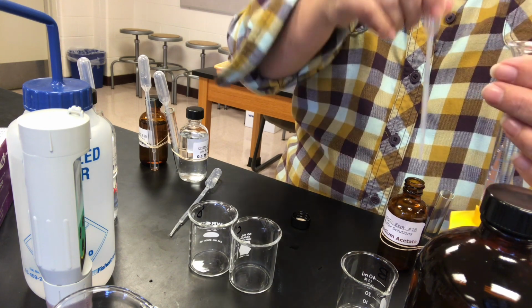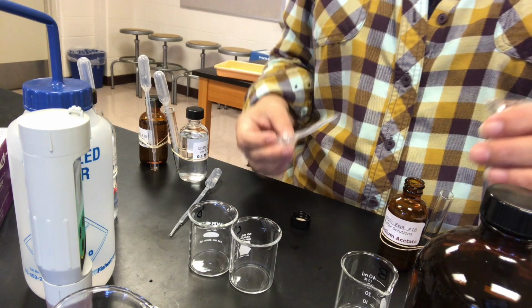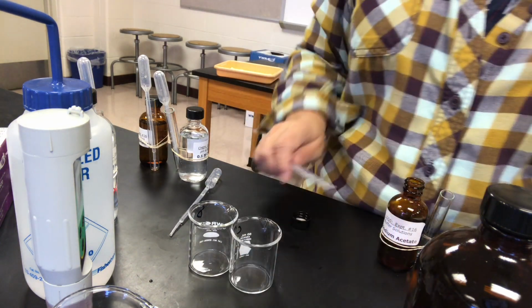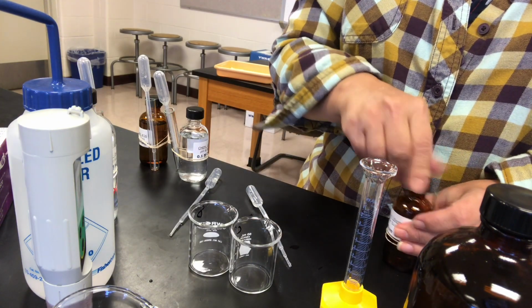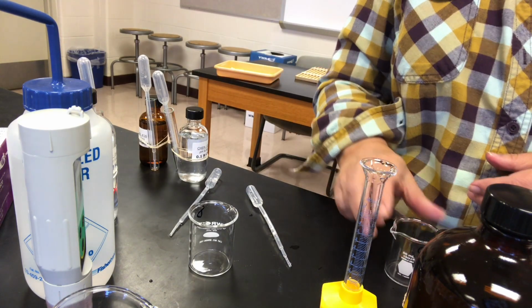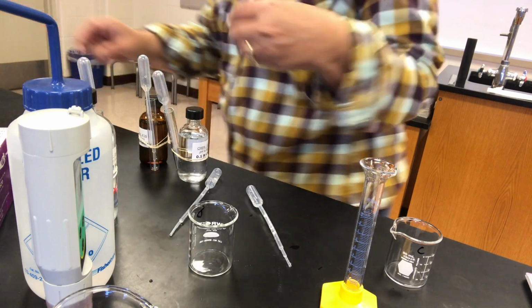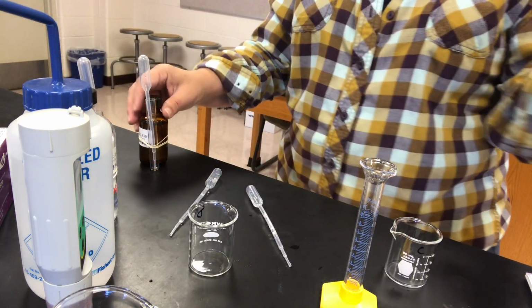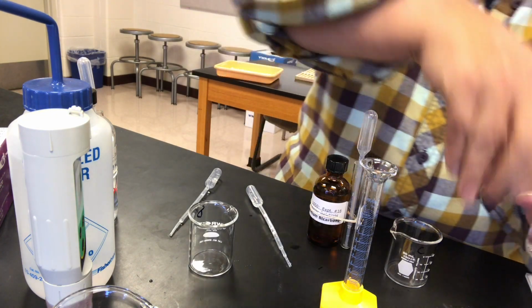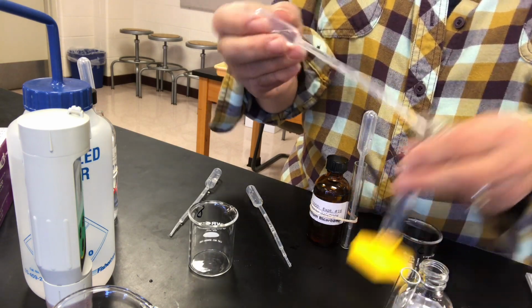A 10-to-1 volume, so it will be 10 for the conjugate base and 1 for the conjugate acid in this ratio for buffer B. Okay, so that's buffer A and buffer B. Similarly, we're going to mix up buffer C using carbonic acid and sodium bicarbonate. So here is my carbonic acid. The first one will be 5 milliliters each of carbonic acid and sodium bicarbonate.